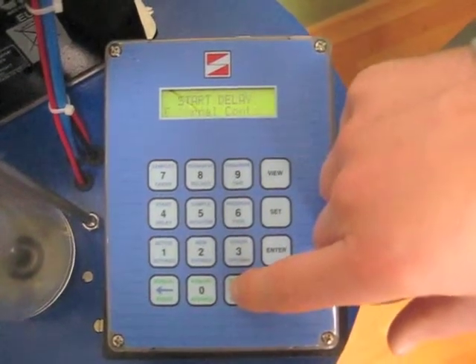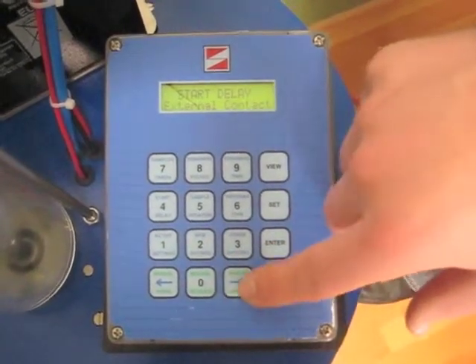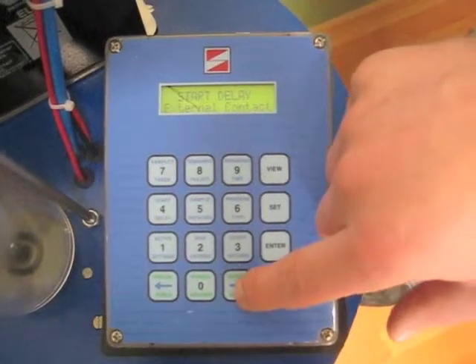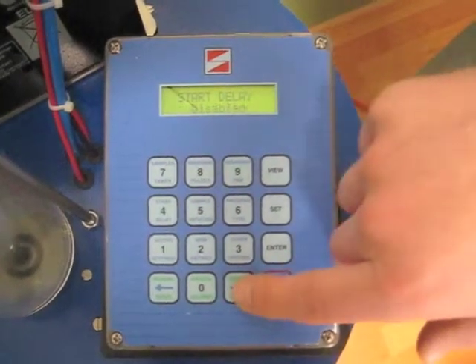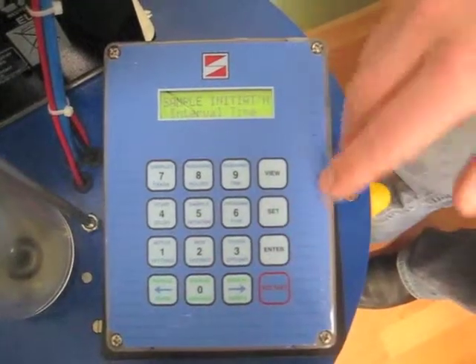An external contact, say you have a PLC or an external source that's sending a signal saying now it's time to start sampling. Level control or disabled which is what I'll choose this time.